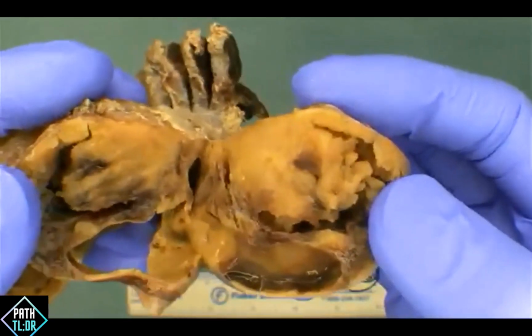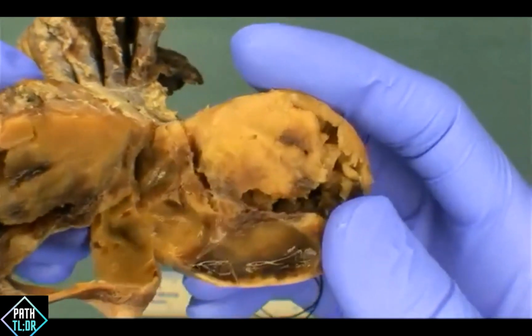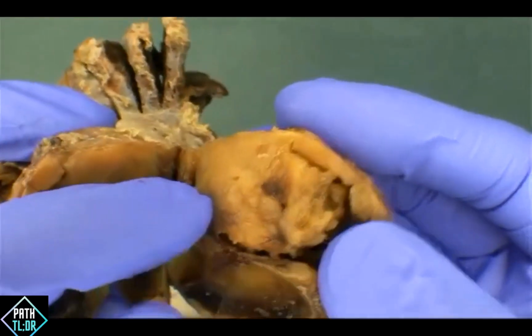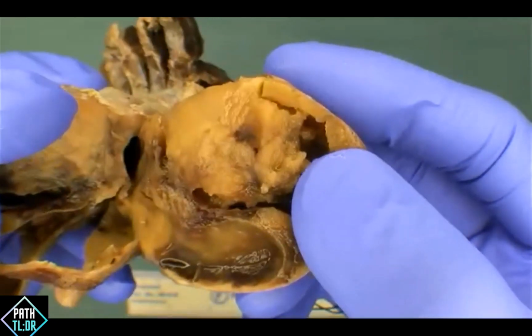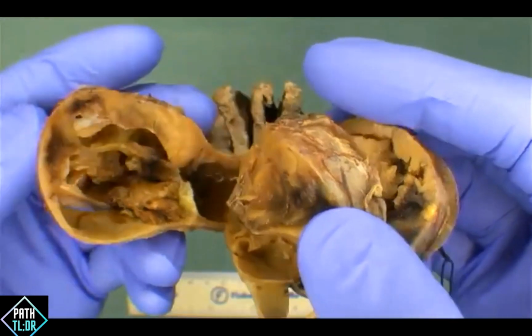Given what that looked like, I thought, oh, this is really strange. It's very interesting. It got me a little bit worried that this is probably a little bit more than a goiter. The solid component here is actually quite solid. This is a little bit friable here, like the papillary part, okay? But then you also say that the content had some of the lesions that came off from there. Yeah, that's right. Exactly.